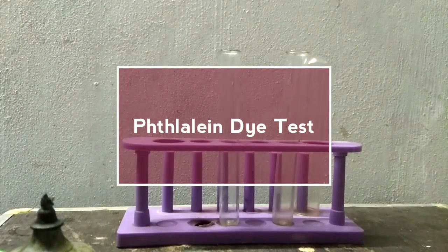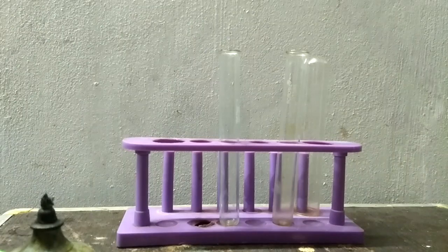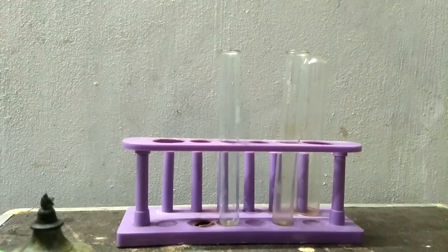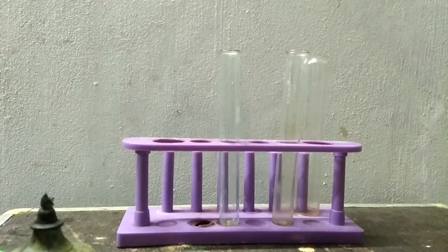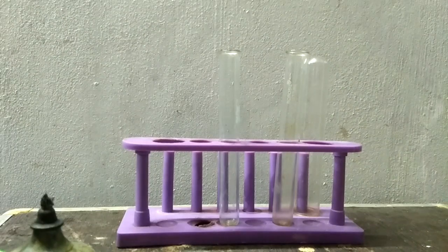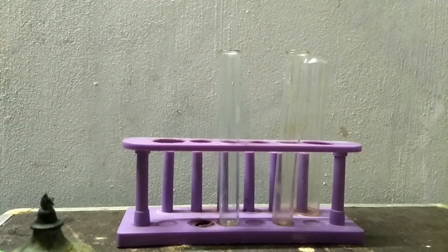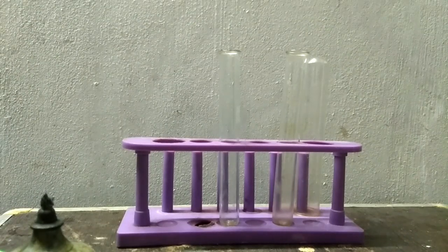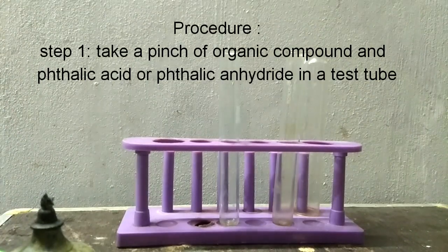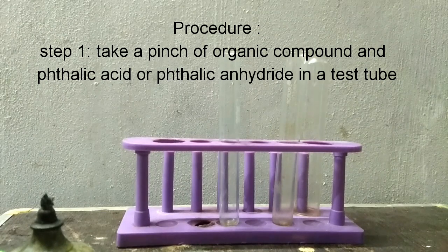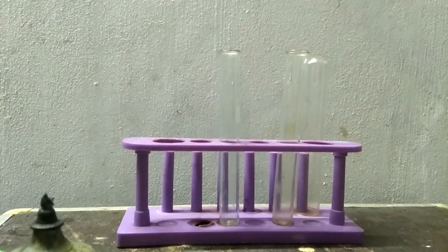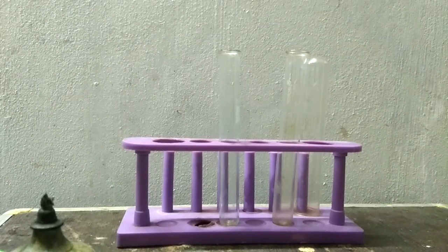Okay friends, so today we will perform the phthalein dye test. It is a test for testing phenols. How to perform the phthalein dye test? We take a pinch of phenol in a test tube.